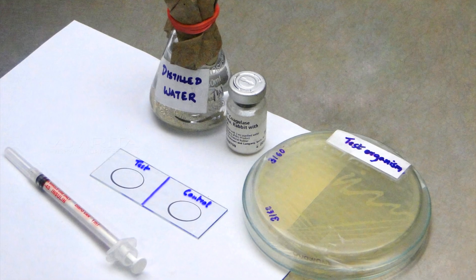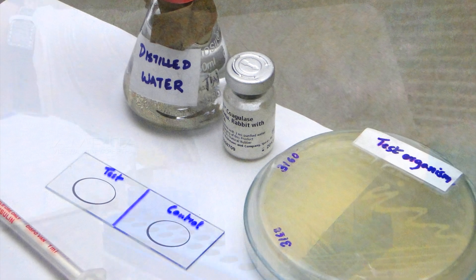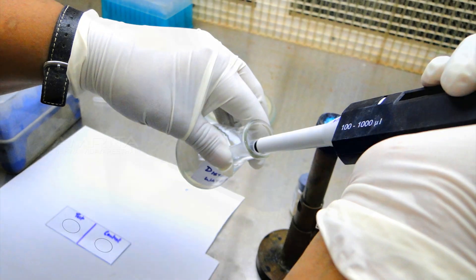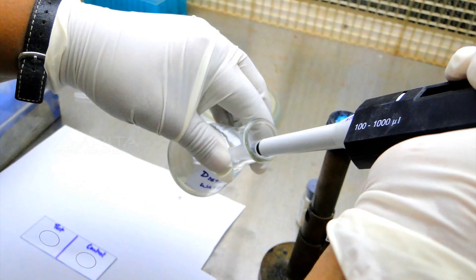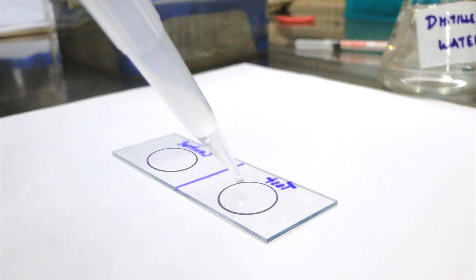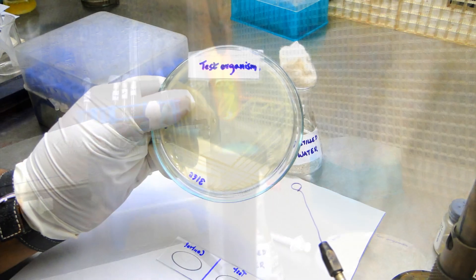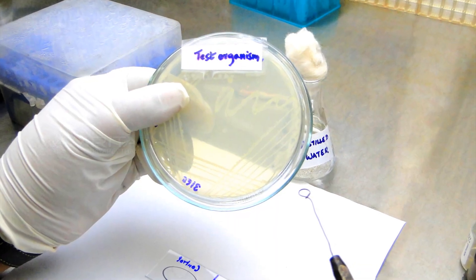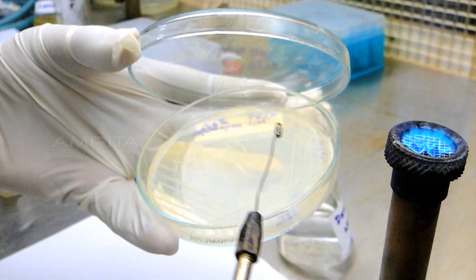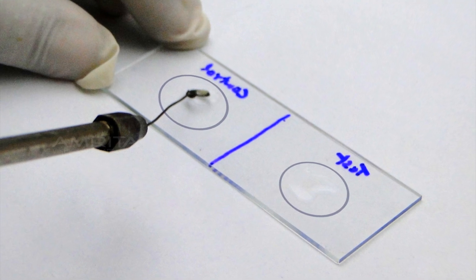Procedure: Arrange all the materials in the laminar airflow. Place a small drop of distilled water on each side of the slide labelled as control and test. Heat the loop and transfer one or two colonies of the test organism from the nutrient agar plate to each drop, and emulsify to make a smooth suspension.